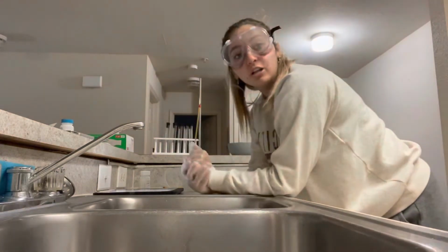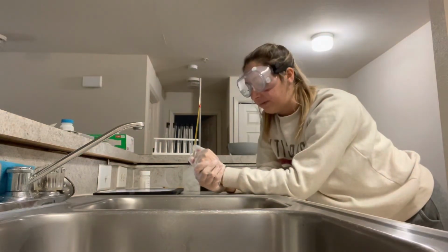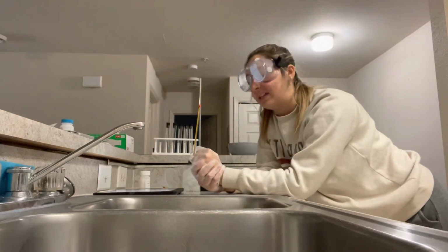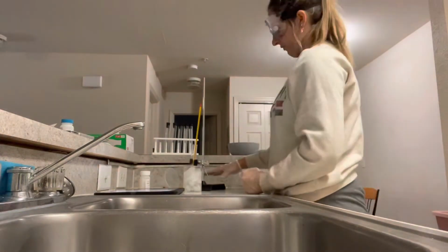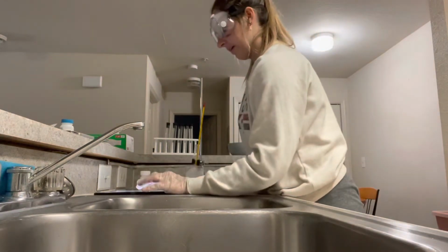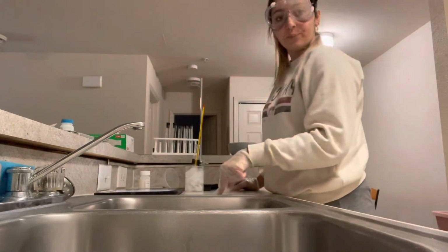It's taking a lot longer to freeze now that we've added the solute. That's what I have begun to find out, because the last one I did not have to wait this long with just the solvent. Fully frozen. It's fully frozen. So now, since I've got all that, we will move to part D right now.